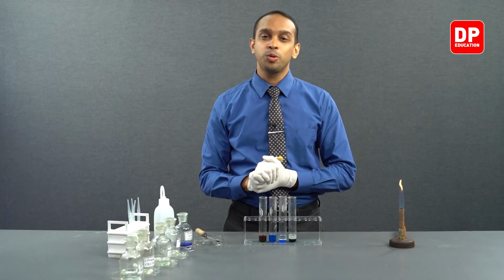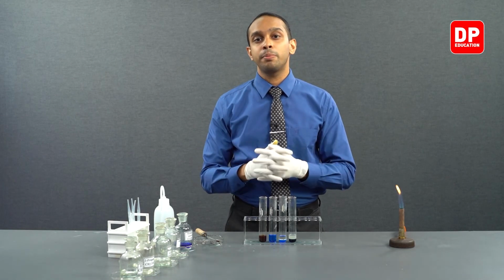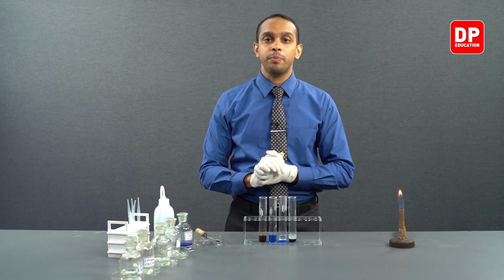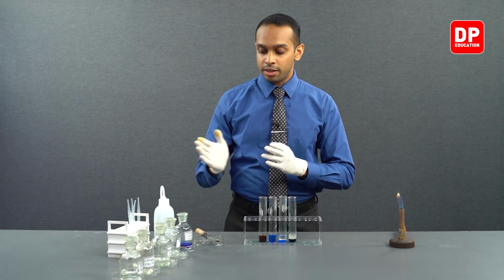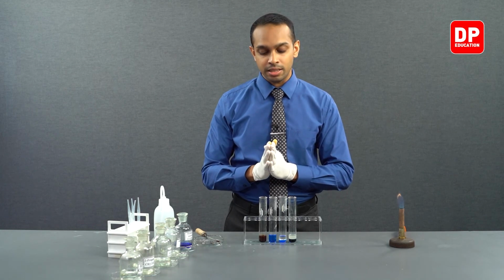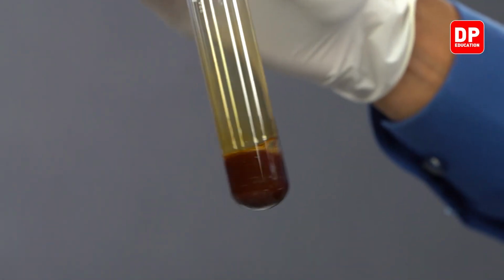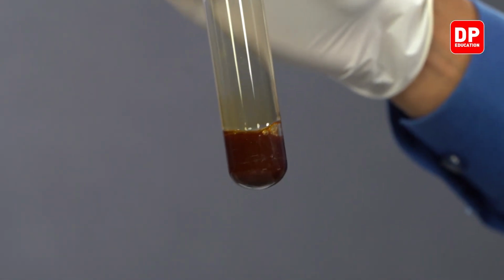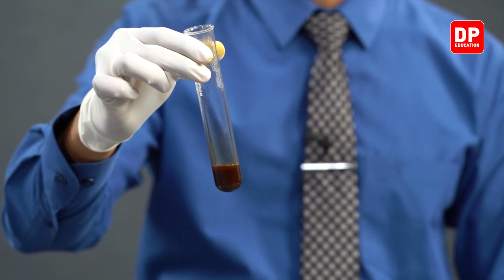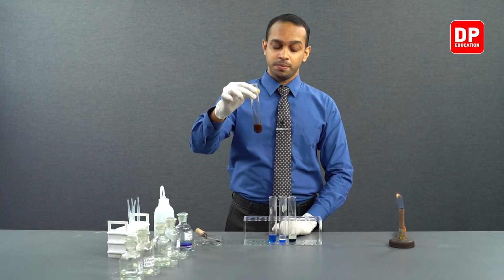Students, let's move on to our summary, and this is our final experiment in the experiment number 27 practical series. So in this final step, we observed that with Fehling's solution, only aliphatic aldehydes give positive results and form brick red color precipitate.